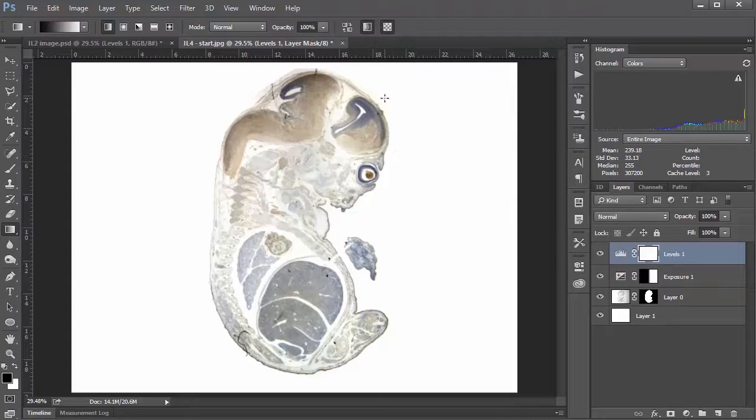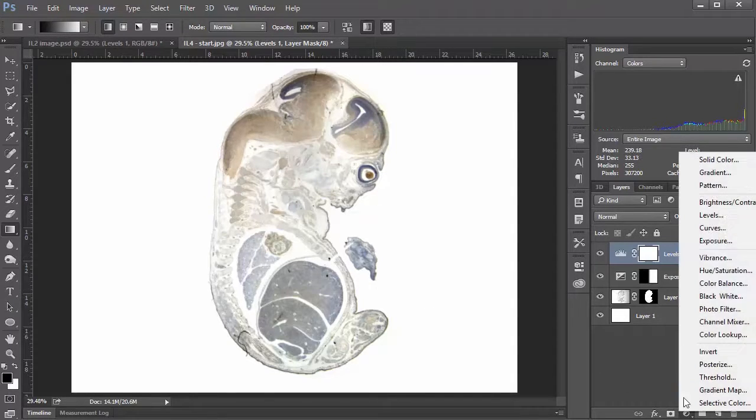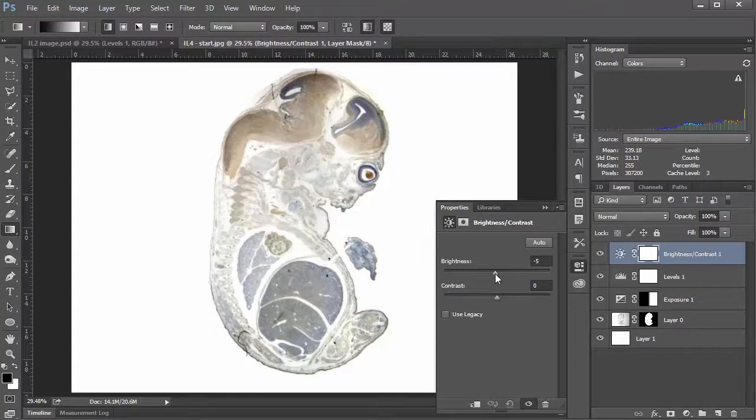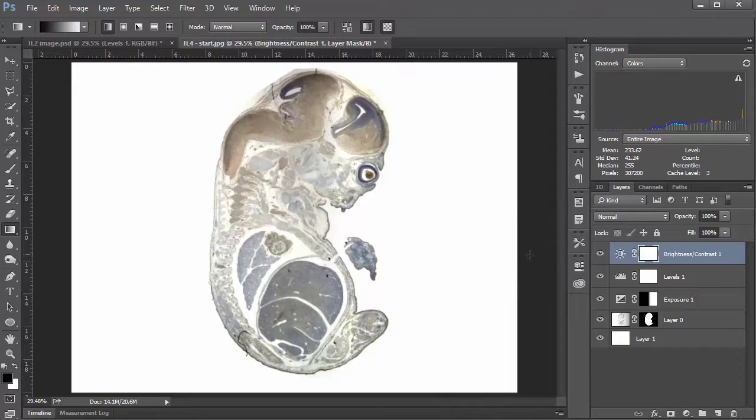And so this, to me, is looking pretty good. Maybe it's still a little on the bright end, and if that's the case, I might go back and put in another brightness contrast layer. Maybe just bump the brightness down a little bit, maybe to about minus 25. And that's starting to look pretty good to me.